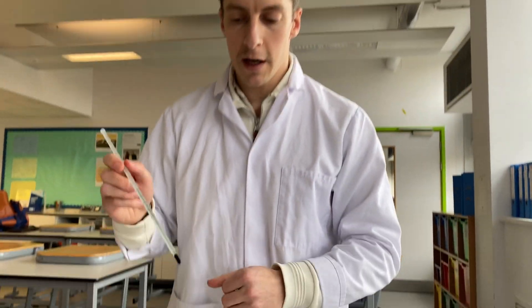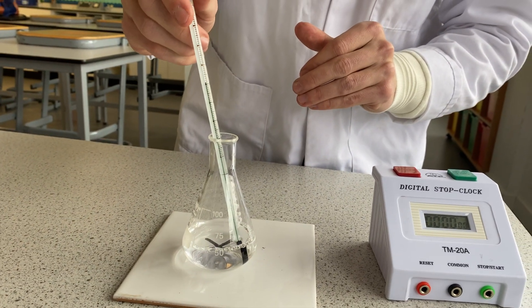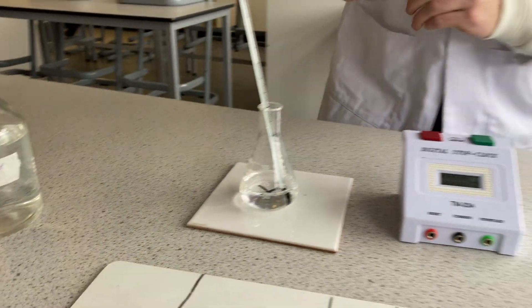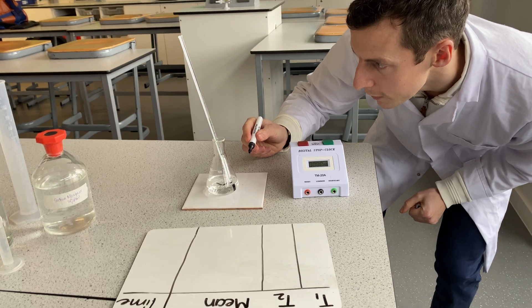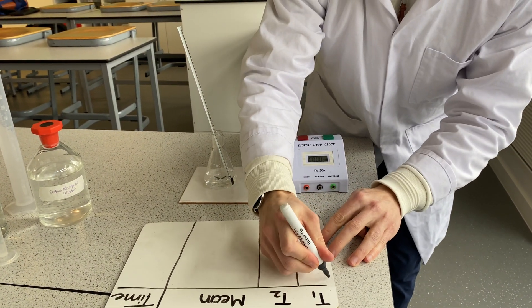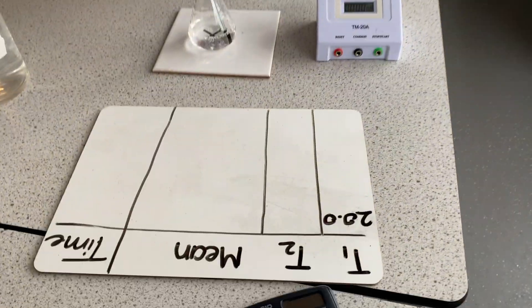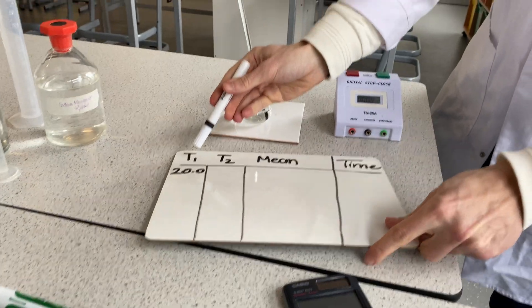One of the things we want to measure is the temperature. Rather than measuring the temperature of the room, I'm going to measure the temperature of the solution. I'll put my thermometer in and measure the initial temperature of the solution. It reads exactly 20 degrees Celsius, which I'll record in my table.